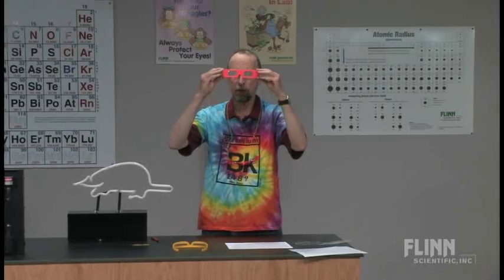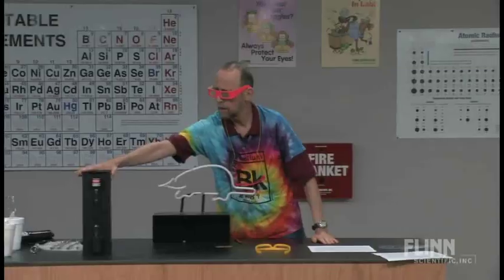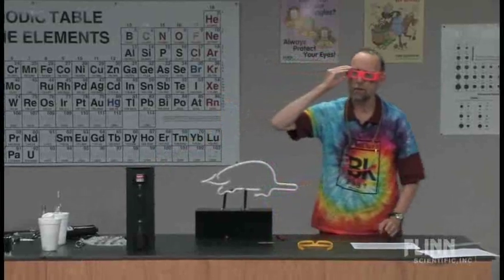I found out they no longer sell these except that one place bought the last ten thousand, which I immediately purchased and used in my classroom because they were dirt cheap. Nowadays you can purchase these diffraction gratings — there are about thirteen thousand five hundred lines scratched in here. You can use these to look at the spectral lines for atoms when you use them with a discharge tube for various gases. My suggestion to save money: cut them in half. No kid wants to walk around with a monocle, so if you cut it in half they won't steal it — they're forced to look at it even more closely because one eye is closed.